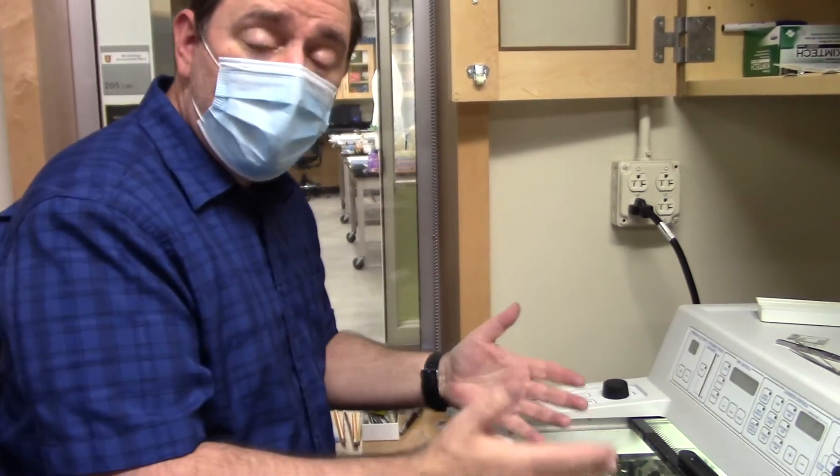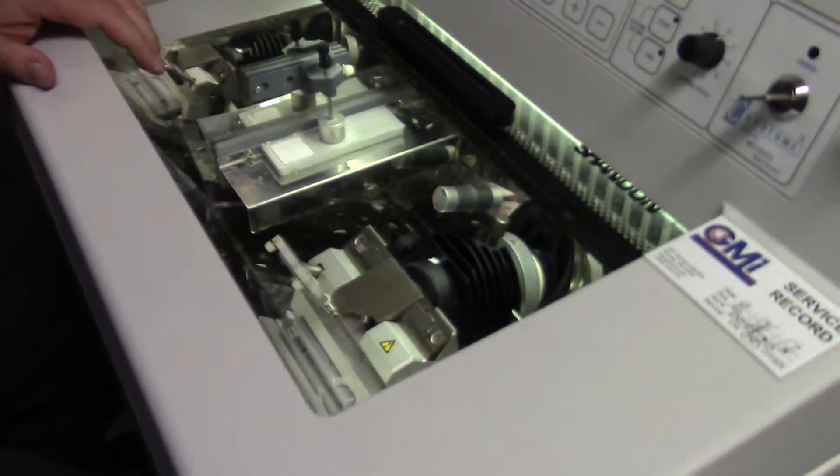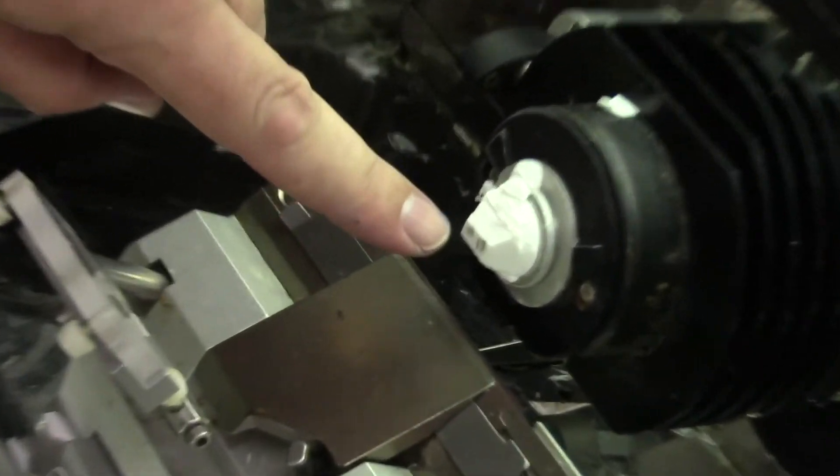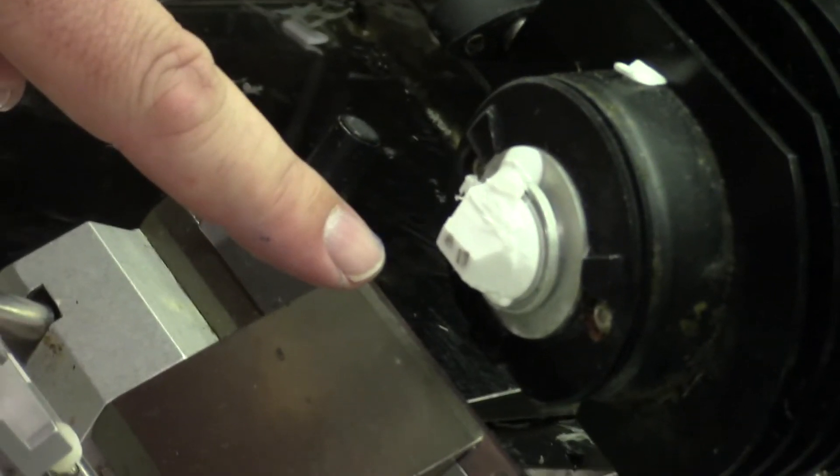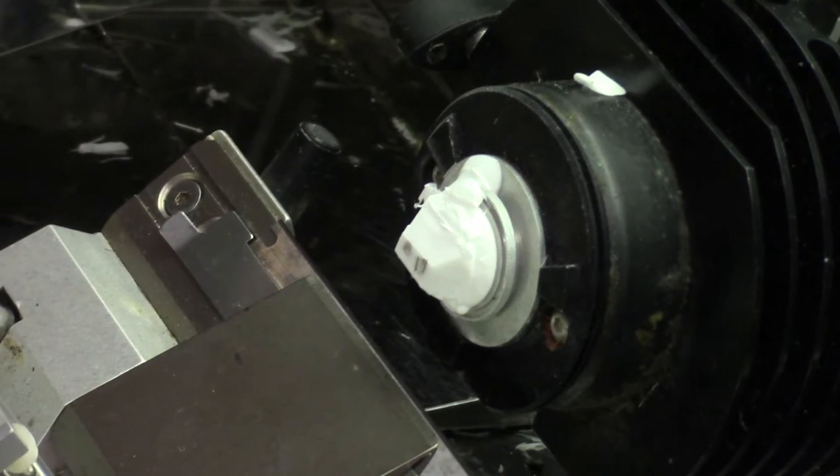Okay, so we're done with sectioning for today, but we haven't sectioned all the tissue. Let's see how much tissue is left here. I can see a lot of tissue still in my block. We're going to want to do this later. We don't want to throw that tissue away, it's exactly the regenerate that we want.